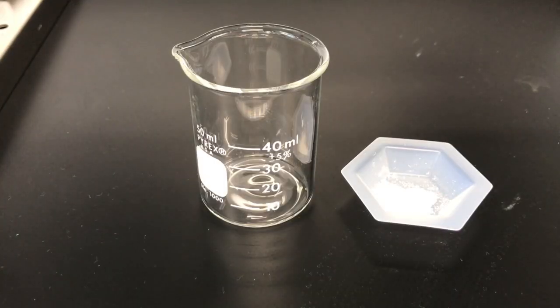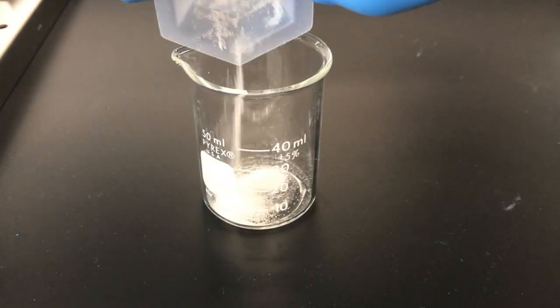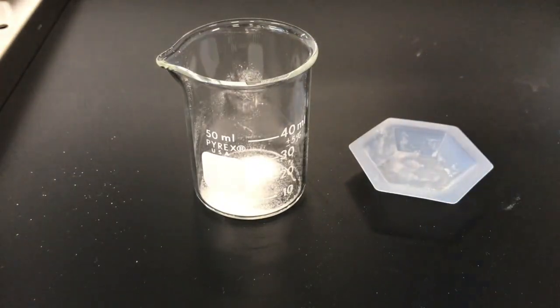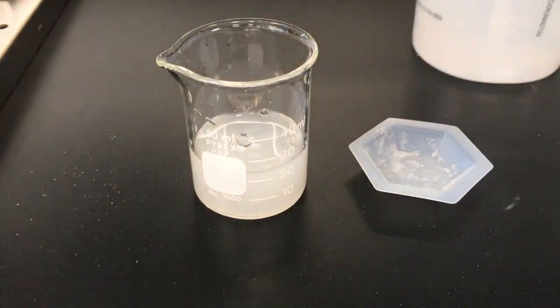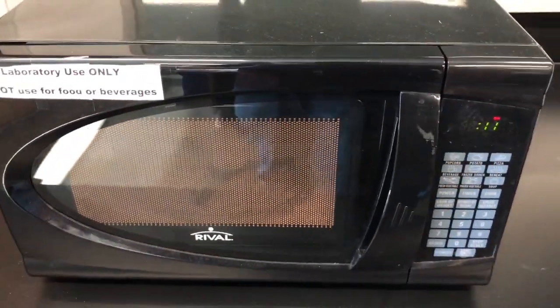The TA will prepare a 1% agarose solution by dissolving some agarose in some water. To fully dissolve, the agarose will be warmed up in the microwave.